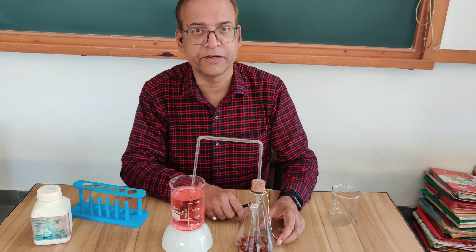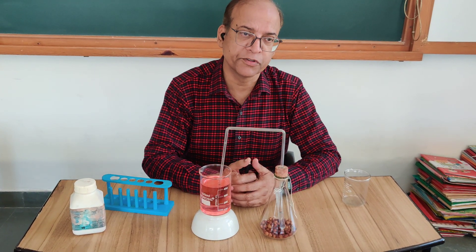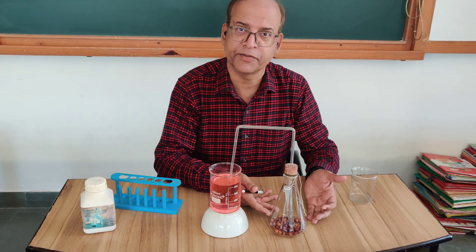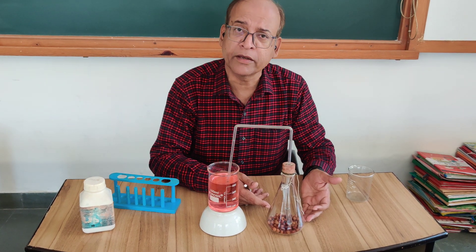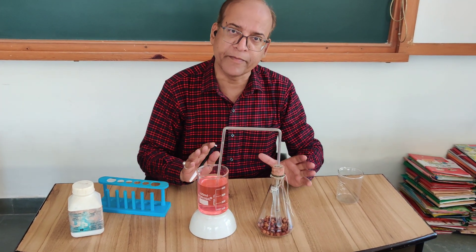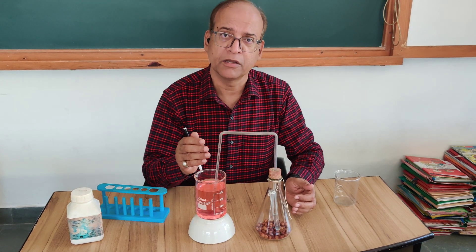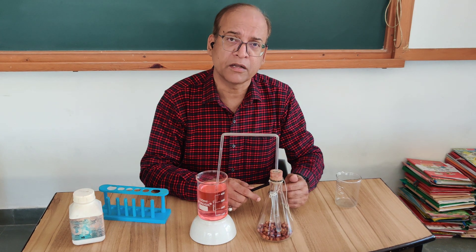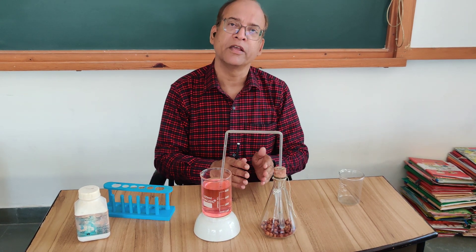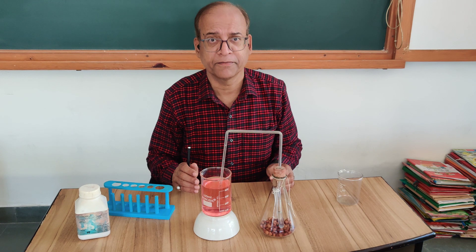Different germinating seeds use different respiratory substrates — some seeds use carbohydrate, some use protein, and some use fat. By taking different seeds, such as gram seeds which we have already used, or seeds rich in carbohydrate or fat, we can compare the rate of respiration using the same experimental setup. In this way, we can get a comparative idea about the rate of respiration with different respiratory substrates.